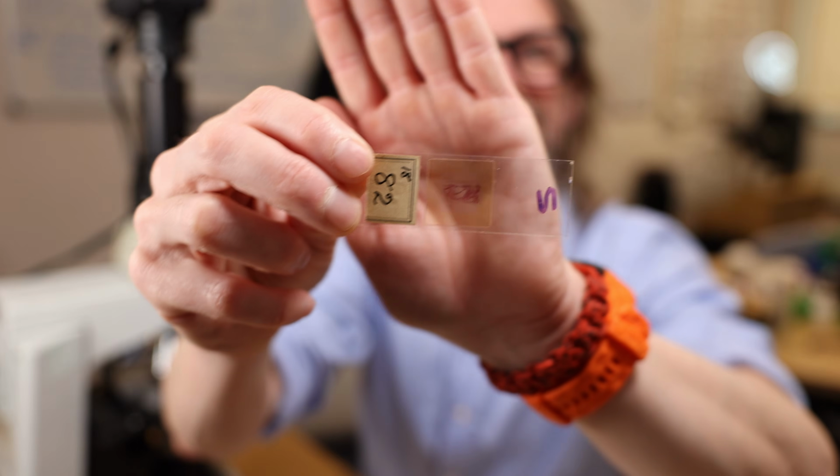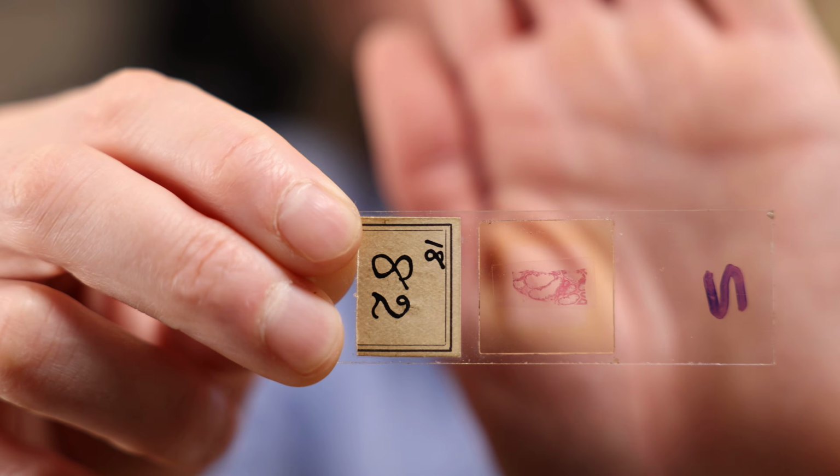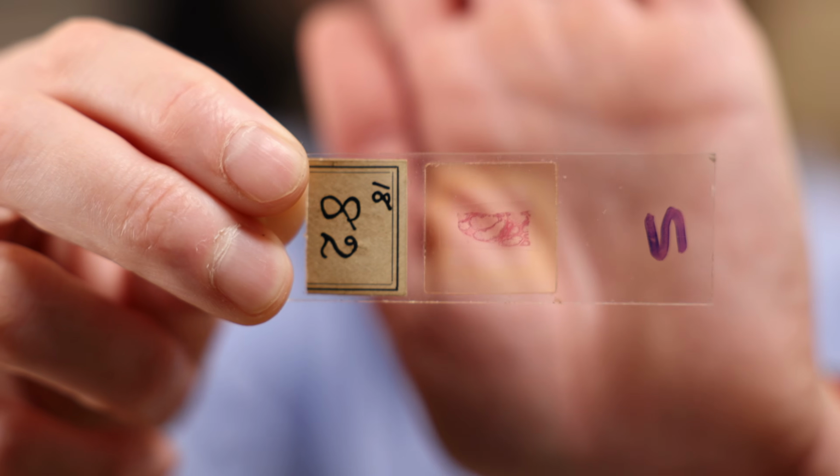And I have this tissue. This is a seminal vesicle. That looks like it's got more space inside it, doesn't it? We can also see an angle and a bit of a corner to it. So this is a cut piece of a seminal vesicle.